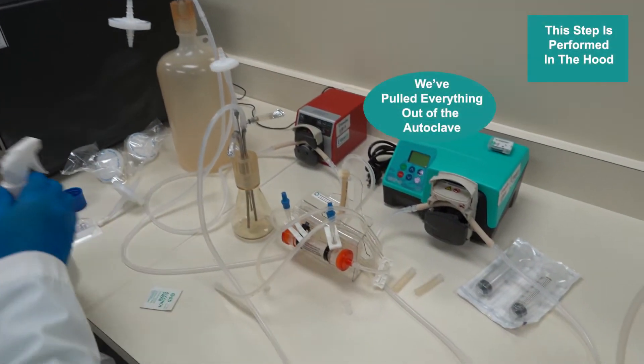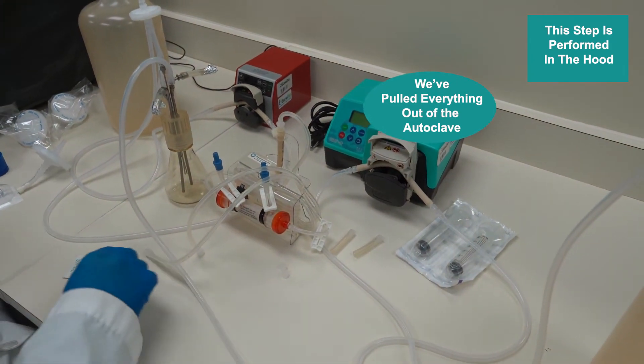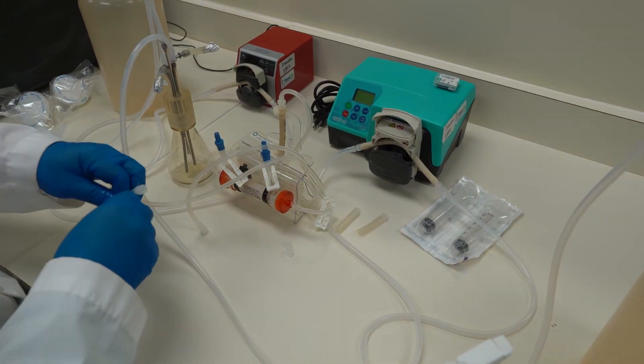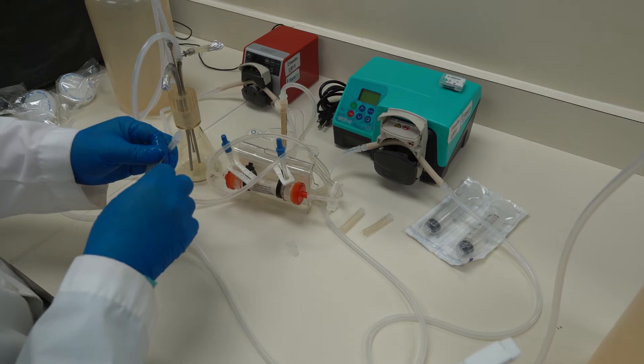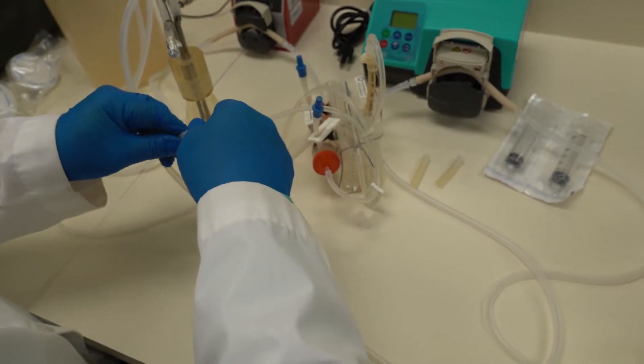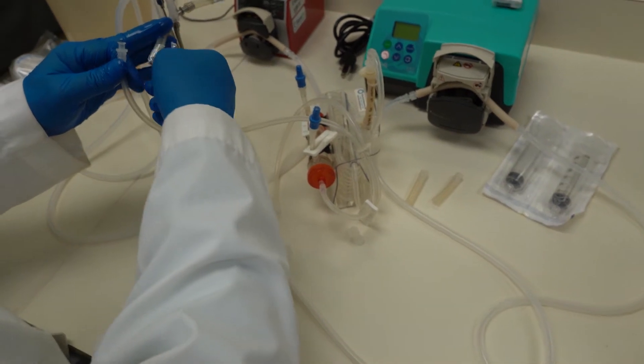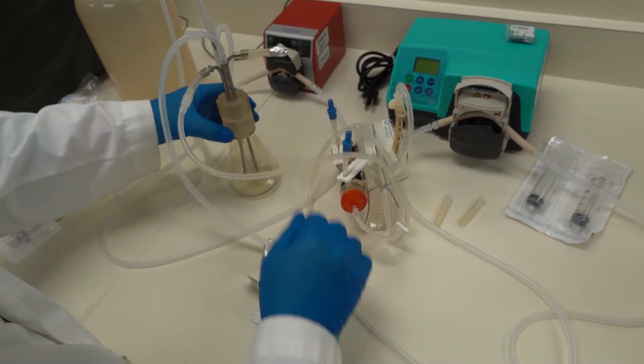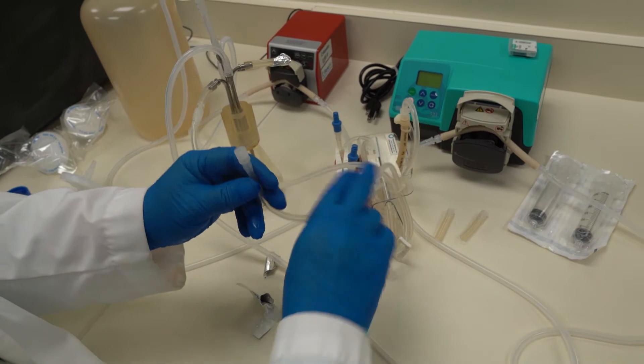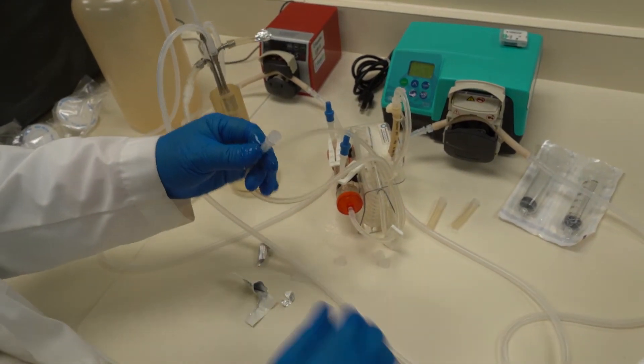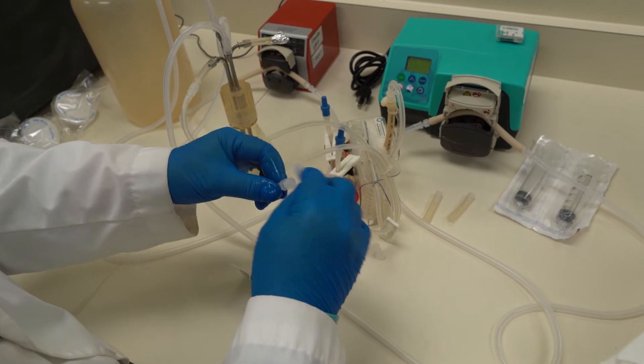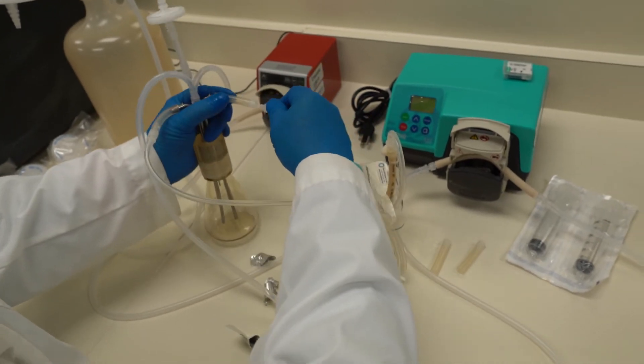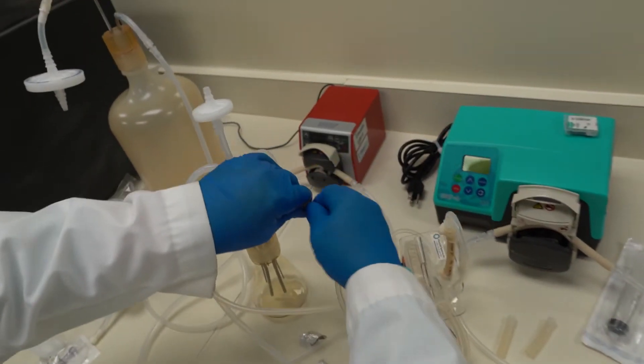Now we've pulled everything out of the autoclave and then we need to do this next step in the hood. So I always like to show people the proper way to handle this. Let's go with some alcohol. A little bit of a backspin. Just like that.